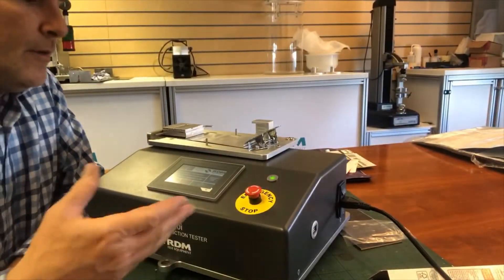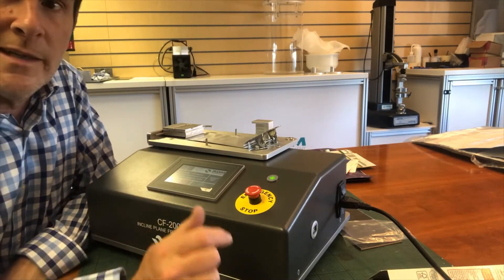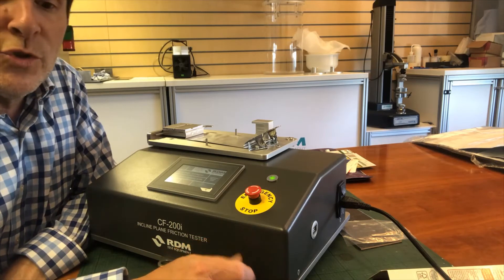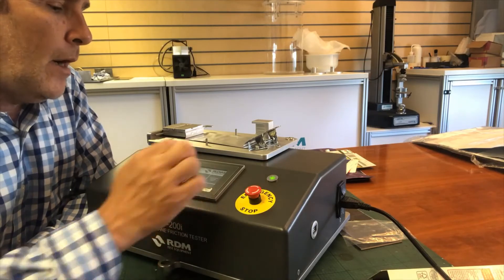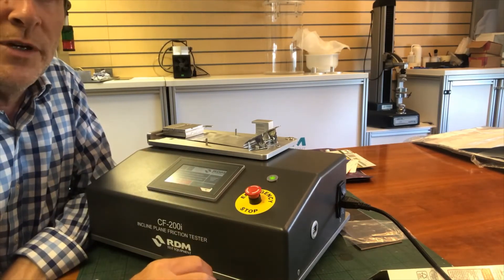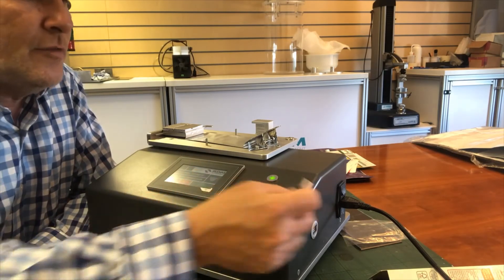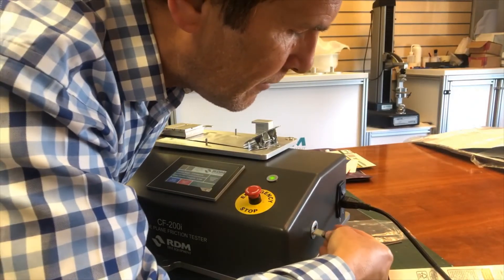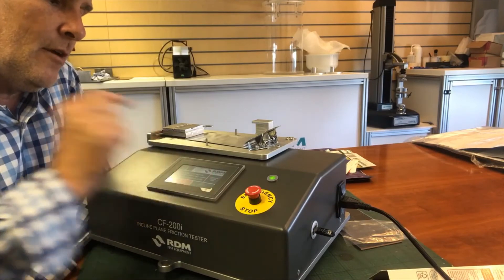Once I've got some results, the touch screen will automatically record all of the results. It will store up to 200 results — I've currently just got three of 200 showing on there. At any time I want to, I can just download them onto a flash drive. I'll place the flash drive in the machine, put it in the right way around, and press the button that says download results.